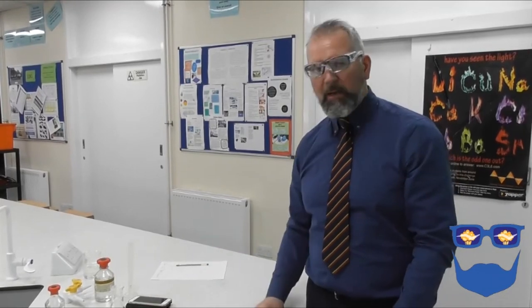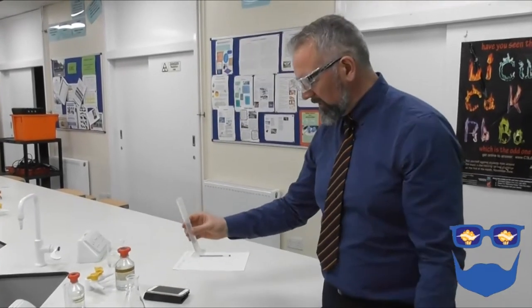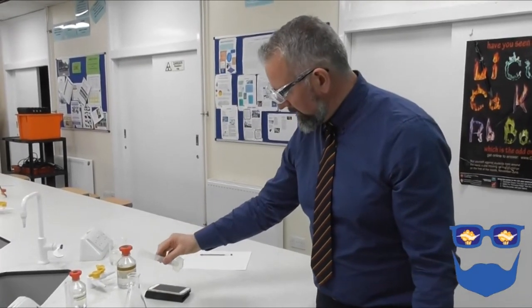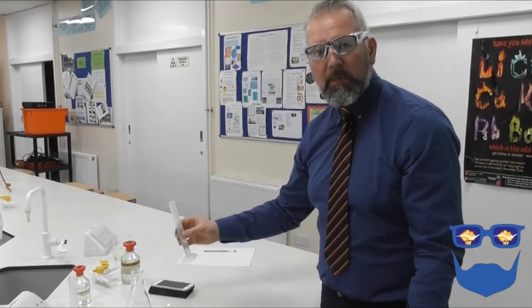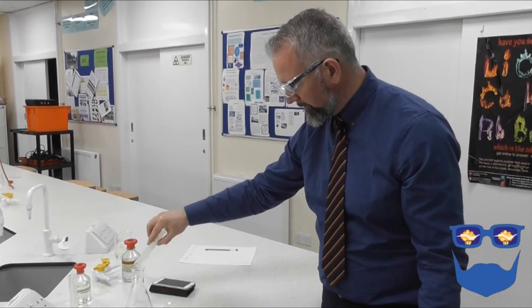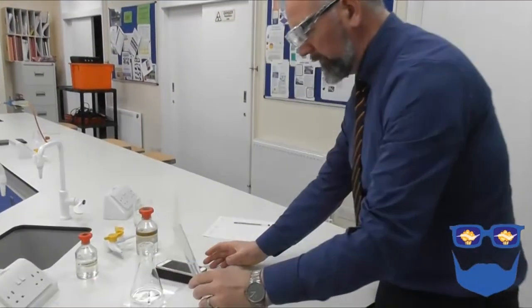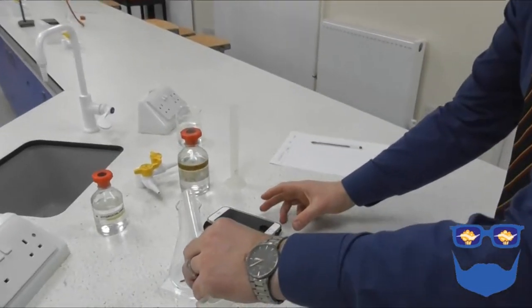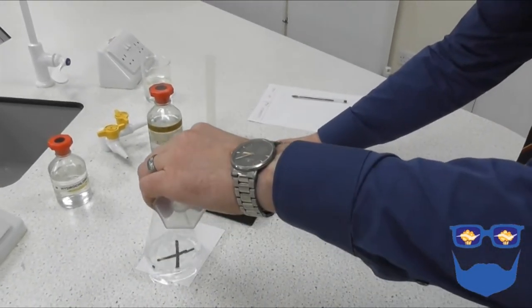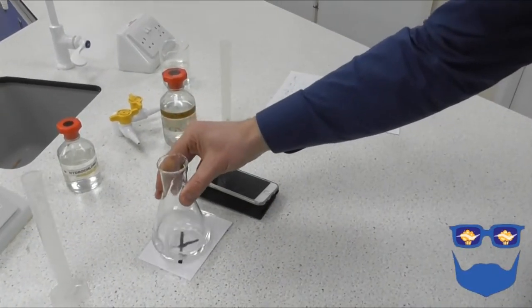So we've set up our next experiment. I've diluted the hydrochloric acid, so I now have 1 mole per decimetre cubed of my acid. I've measured out my 20 centimetre cubed of sodium thiosulfate. Remember, we need to keep our variables the same, our control variables the same. And as we did before, pouring in our acid, starting the stop clock at the same time. There we go. Give it a swirl to make sure it's well mixed.